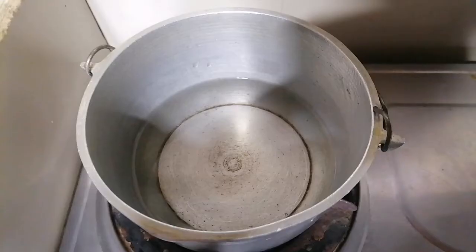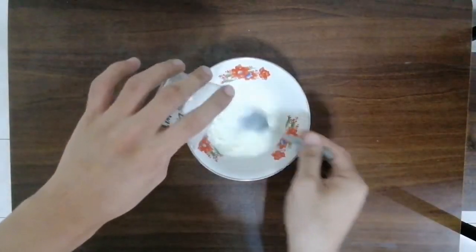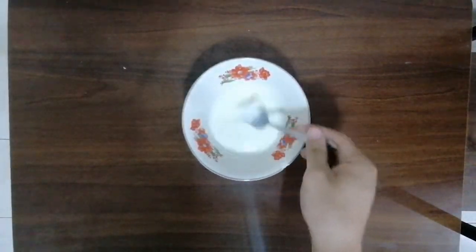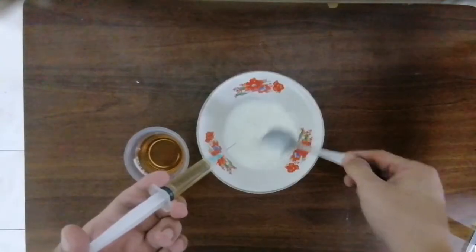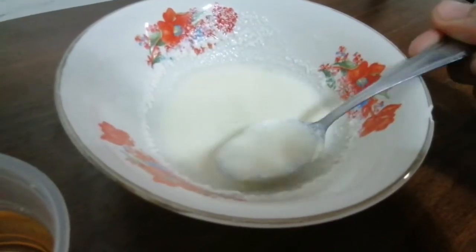To start, heat water at 40 degrees Celsius. Measure whole milk for about 2 spoonfuls or 5 grams and put it in the container. Pour 30 milliliters of the water into the milk and mix. Add, drop by drop, acetic acid or the vinegar while stirring the milk suspension.